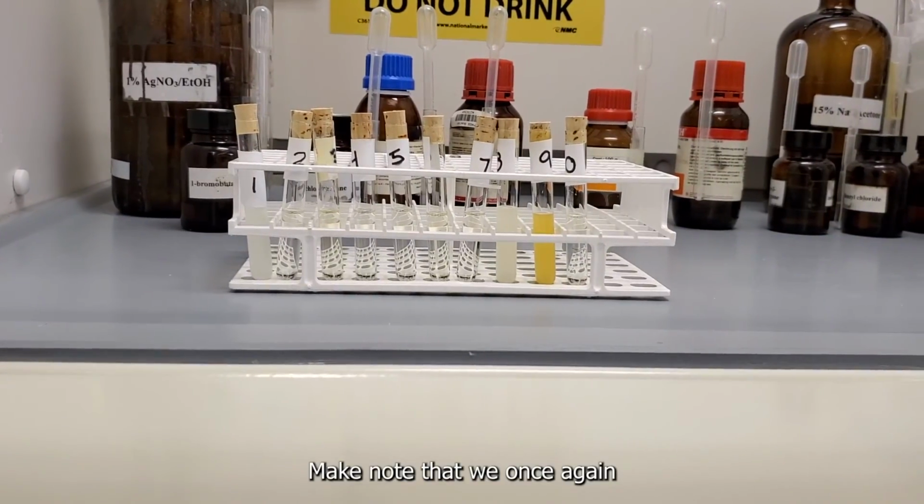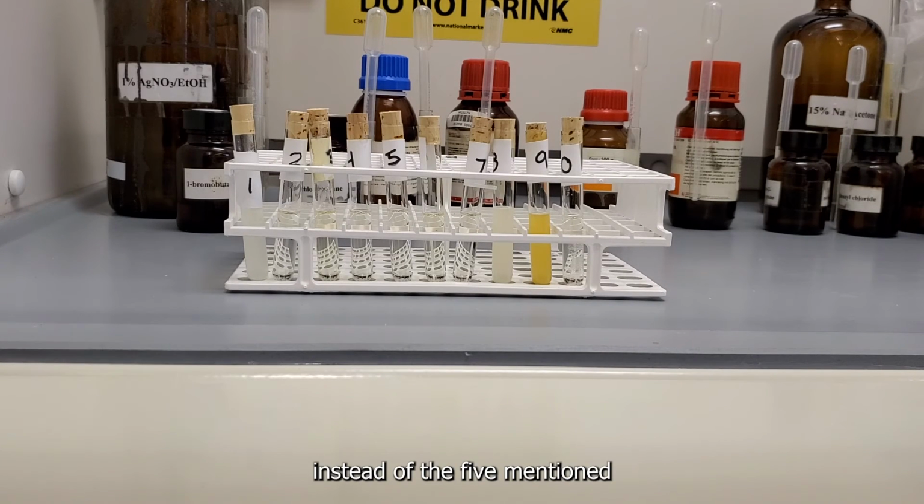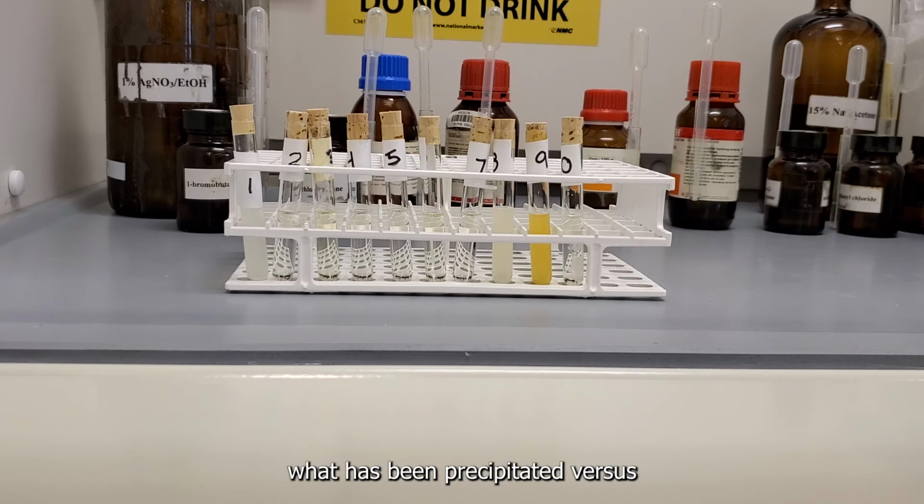Make note that we once again let this sit for 10 minutes instead of the 5 mentioned in the procedure. And at the end of this portion, we then separate the tubes, what has been precipitated versus what we will be putting in the water bath. Please observe this portion. Feel free to fast forward to the next section if you'd like, or the end of this portion to see what has been precipitated.